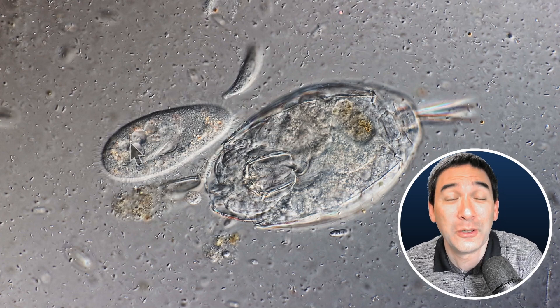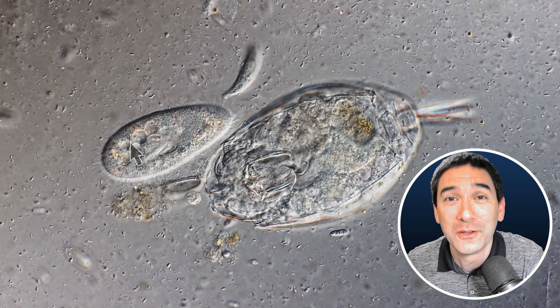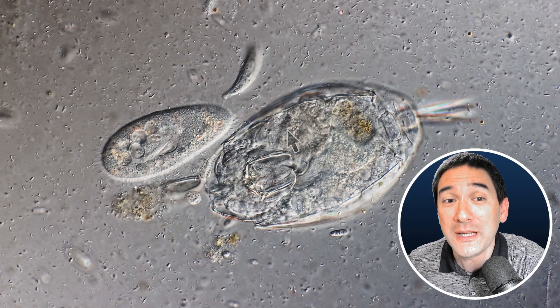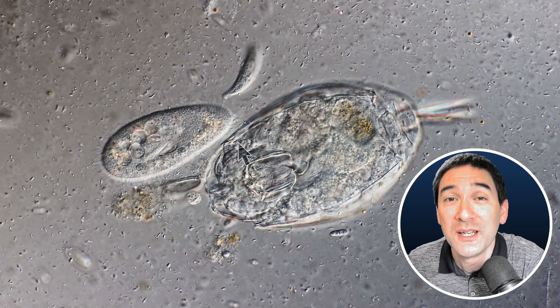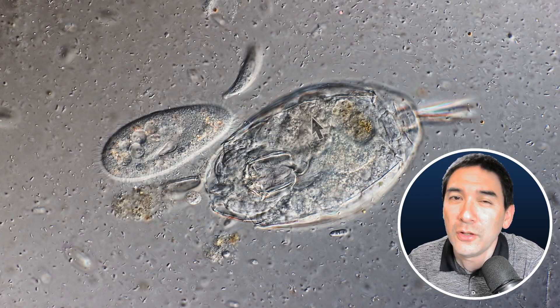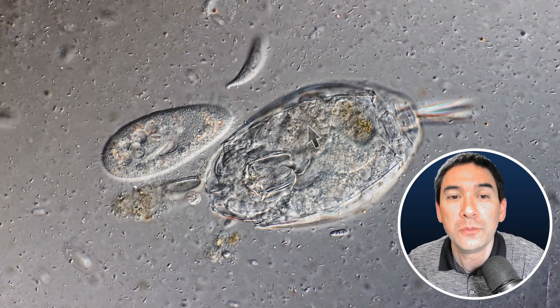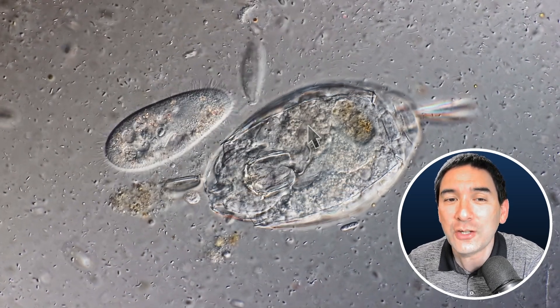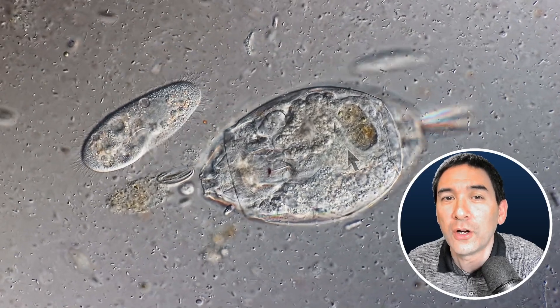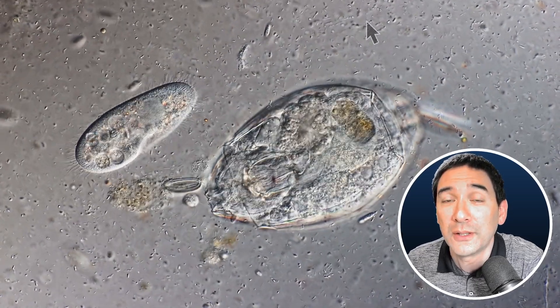Just some biological terms that some of you might already be familiar with. But the real question that I would like to answer today is: why am I not able to see the 1,000 individual cells of this rotifer over here? You're probably going to say, maybe that's because they're too small to be seen. And that is actually not the real reason, because the cells of this rotifer are actually quite a bit bigger than the bacteria here in the background.